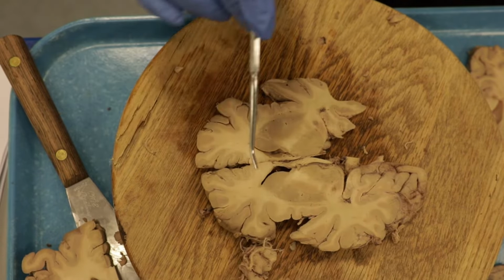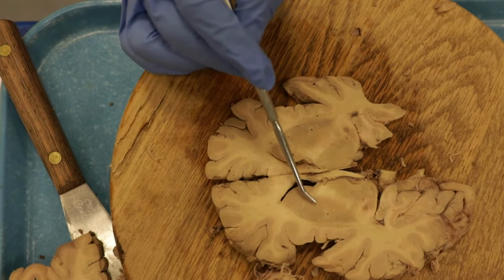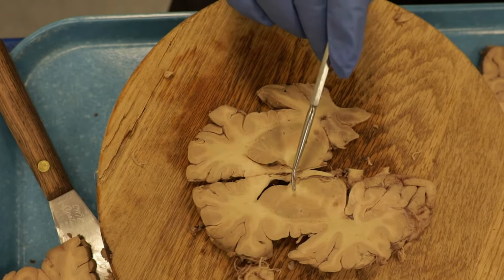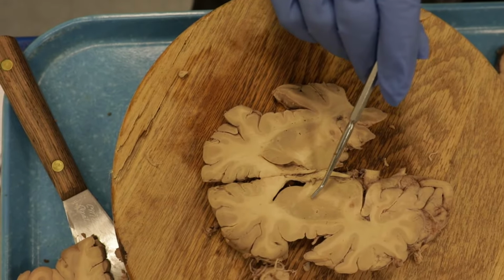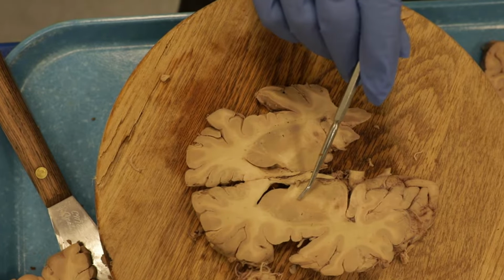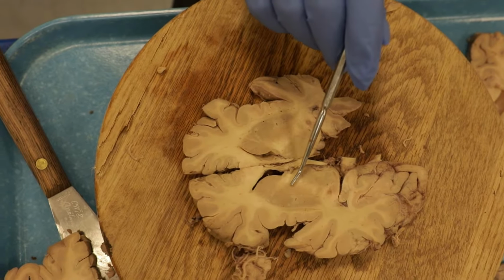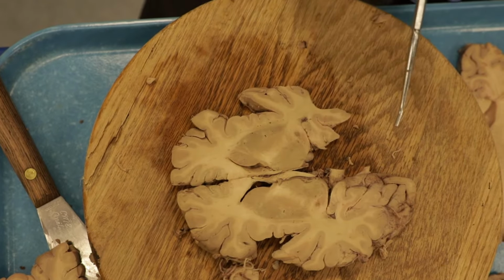Lateral, last time we had the putamen, but notice, can you see there's a little separation right there? Okay, and that separates the putamen, which is lateral here, from the globus pallidus. Okay, so the globus pallidus, specifically there's an internal and an external part of the globus pallidus, which I think we really can't appreciate here, but it's that internal portion, kind of the medial part of the globus pallidus, which is most of the output of the basal ganglia back out to the motor cortex. So again, the parts of the basal ganglia we've seen so far are the caudate, the putamen, and the globus pallidus. So globus pallidus talks back to the motor cortex here through this internal portion.